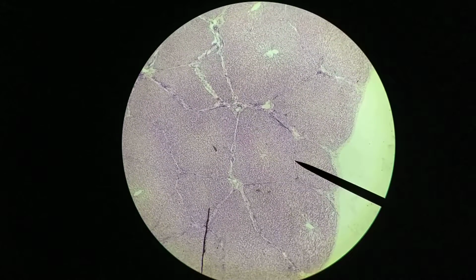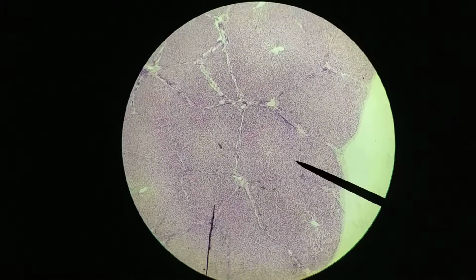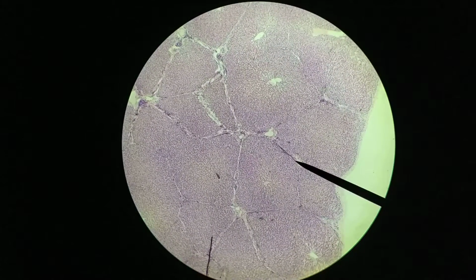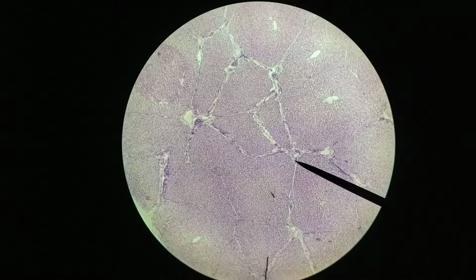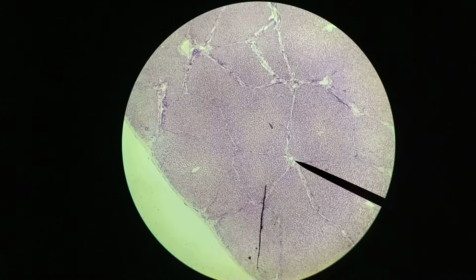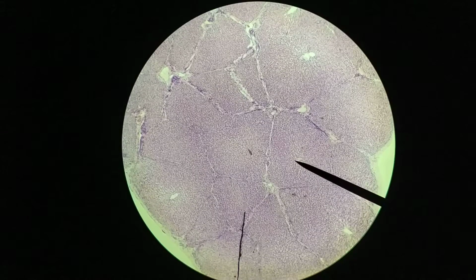What we're looking at is a hepatic lobule. Basically it's a roughly hexagonal or pentagonal structure, and at the corners of this structure you have these portal triads, what you're seeing up here for example. There's another one over here, another one over here, another one here, and all of this is around the outside of the structure, defining its outer edges. And then in the middle, what you have is a central vein. So here's a central vein over here.